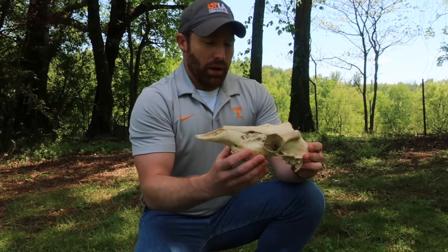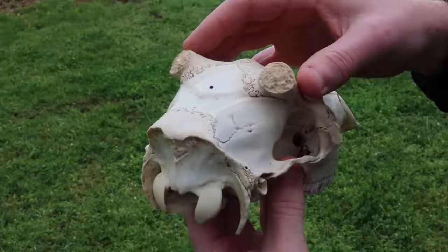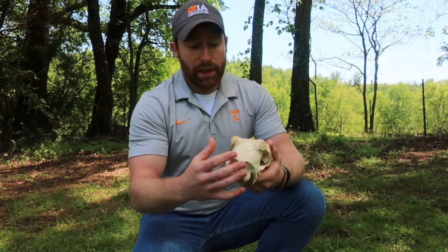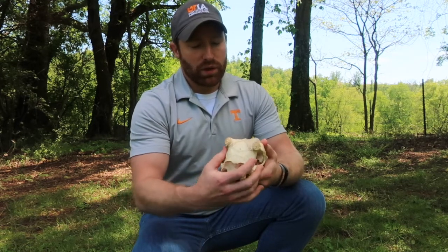So you can also see on this animal that at the beginning are antlers, and antlers are different from horns. Antlers are made out of bone, and horns are made out of what our fingernails and our hair are made out of, a really strong protein called keratin. So it's a little bit different.